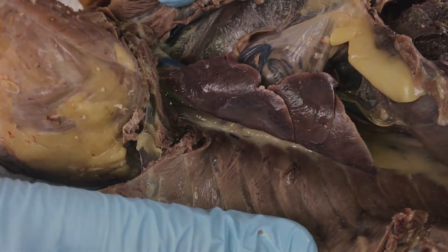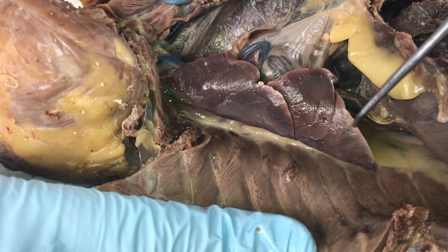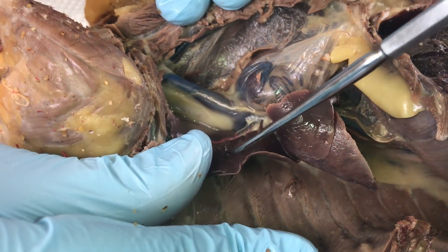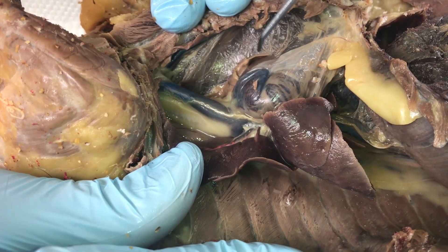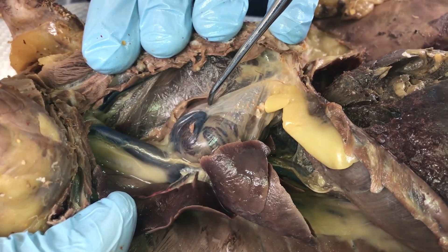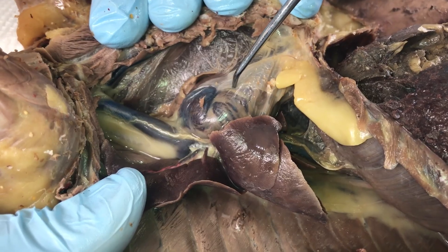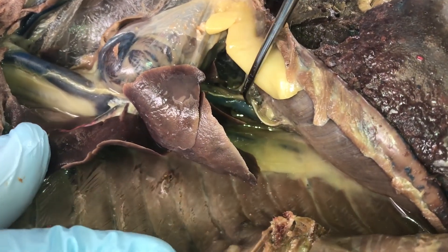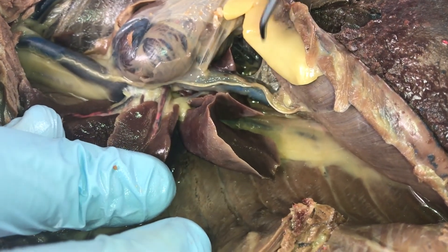We can also take a closer look at the thoracic cavity. Here we have the lobes of the lungs. Moving those out of the way, you can see the superior vena cava and the pulmonary trunk. You can also see the heart situated in its pericardium in that thoracic cavity. Both atria are very visible from this view. You can also see the inferior vena cava, which is more visible once those lobes of the lungs are moved.